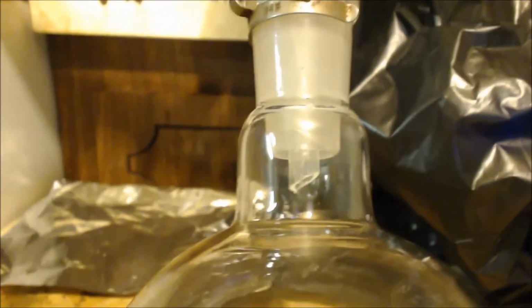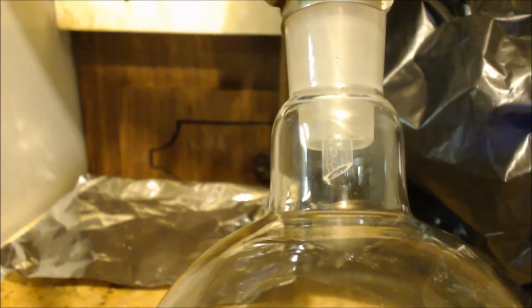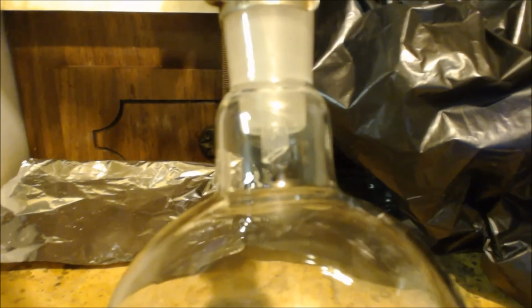See, there's the receiving flask. You don't have to go slow because you're just basically trying to get the solids out. So you can go at a pretty good rate. I wanted about a drip a second, but after so long I'll jack that up so it goes faster.